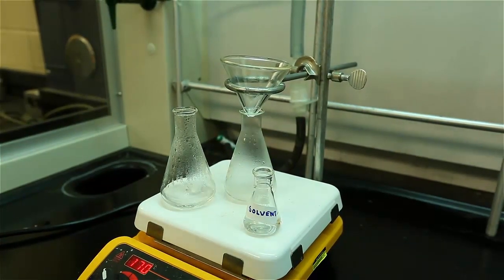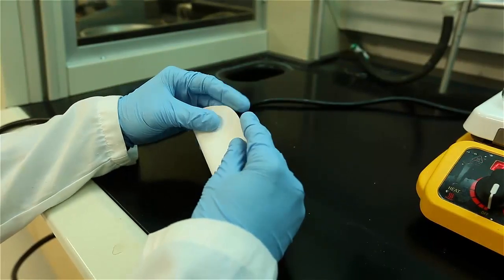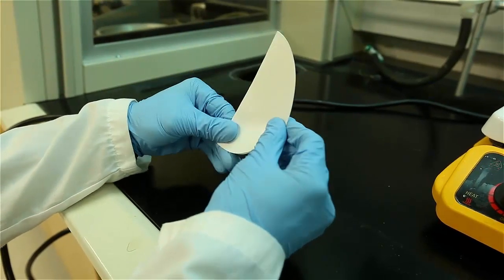Start by obtaining a large filter paper and folding it into the fluted appearance. This will increase the surface area for the solution to filter through.